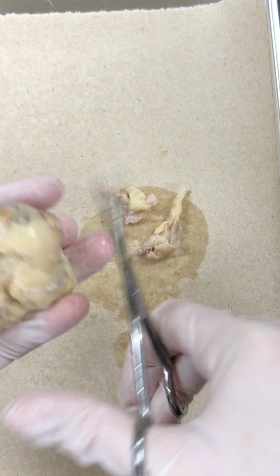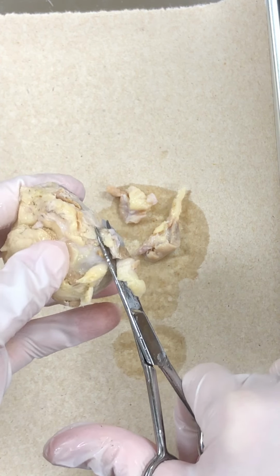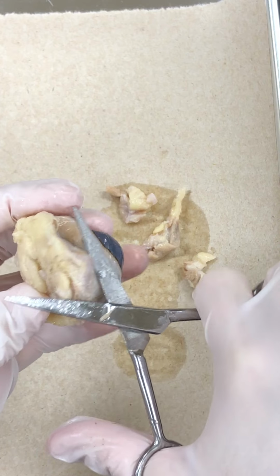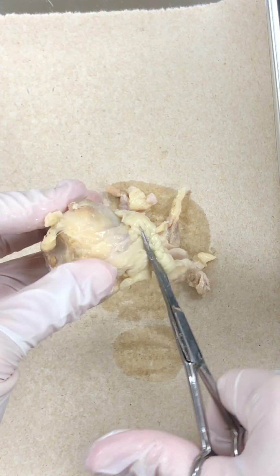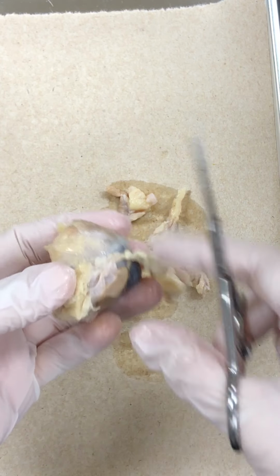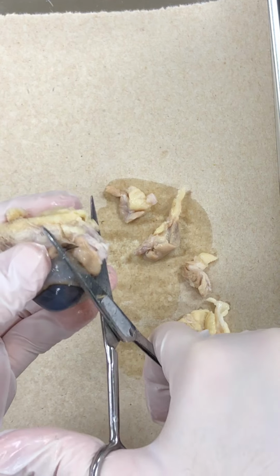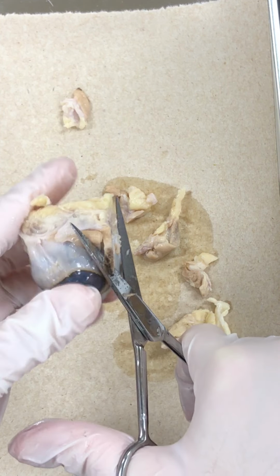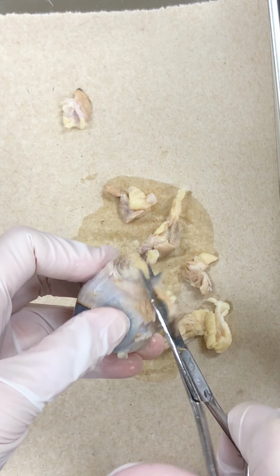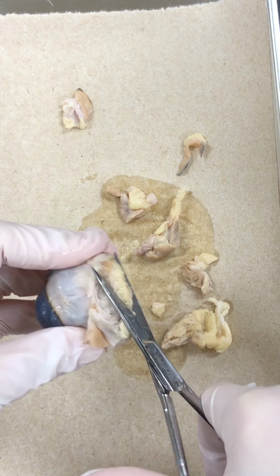Now I'm just going to start trimming away a lot of this tissue back here posteriorly. I really don't need to worry too much about cutting into the actual interior of the eye because the sclera is incredibly tough. The sclera is the white part of our eye that we see when we look at each other. It also makes up the outermost layer or tunic of our eye in the sheep eye. Lots of similarities between the human eye and the sheep eye.